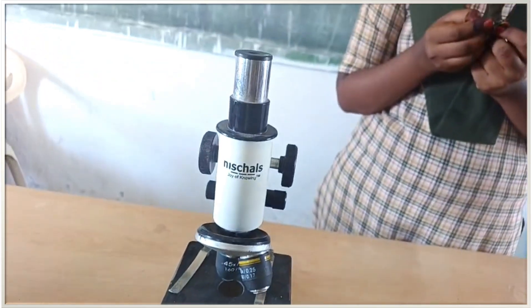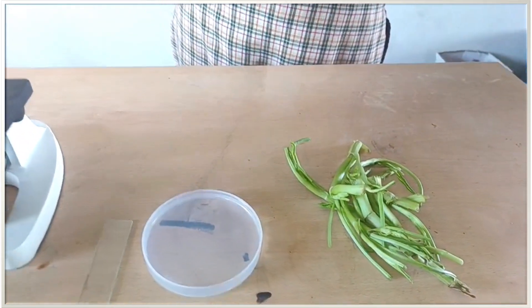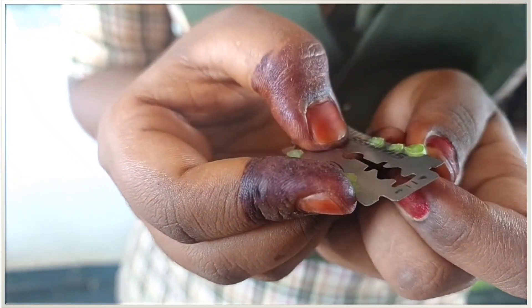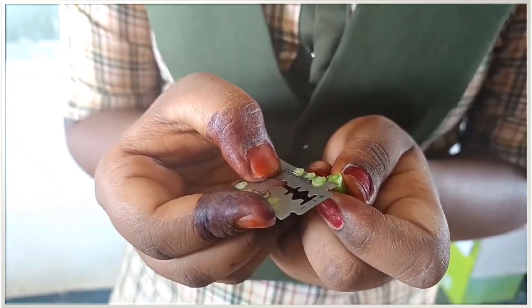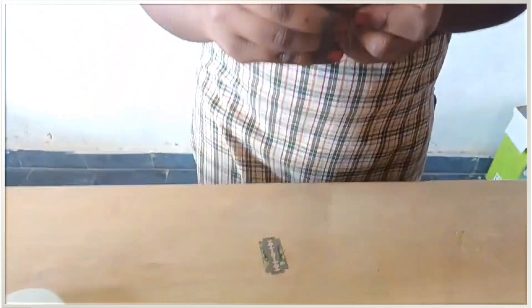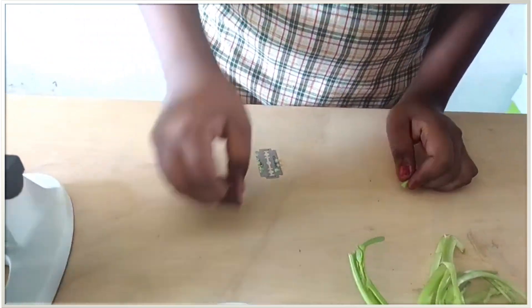She is going to cut the stem with the help of a blade into very thin slices or sections. She cut the stem into very thin slices, because only then we will be able to observe the different types of tissues present in the stem.